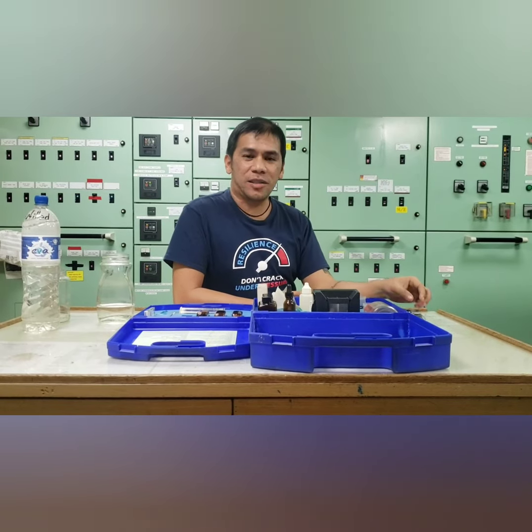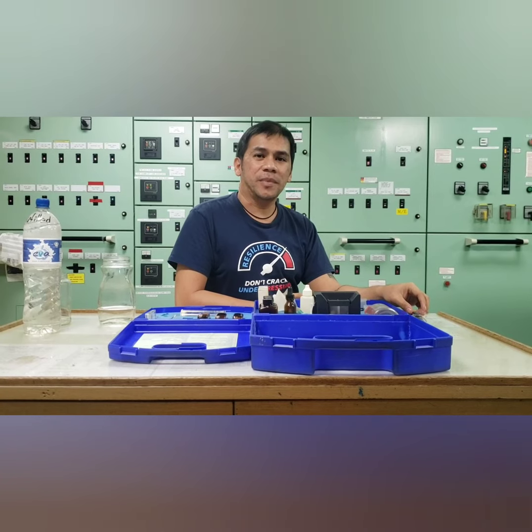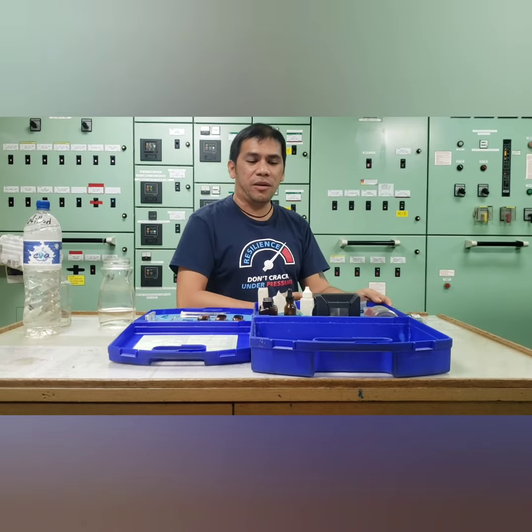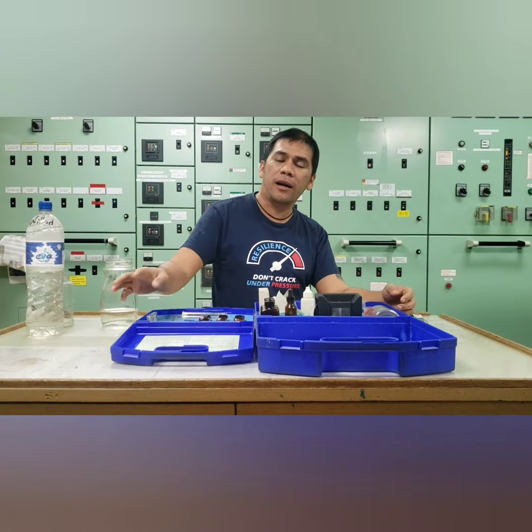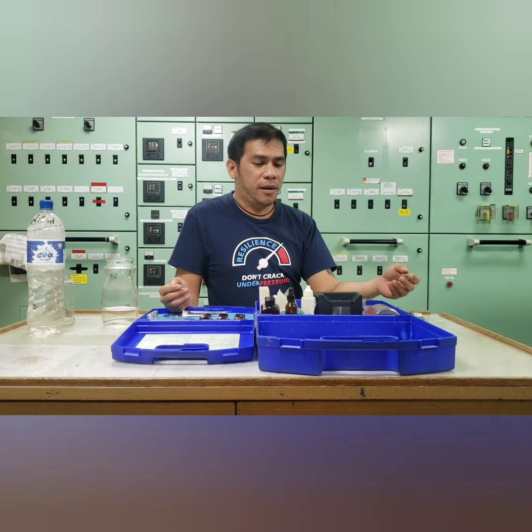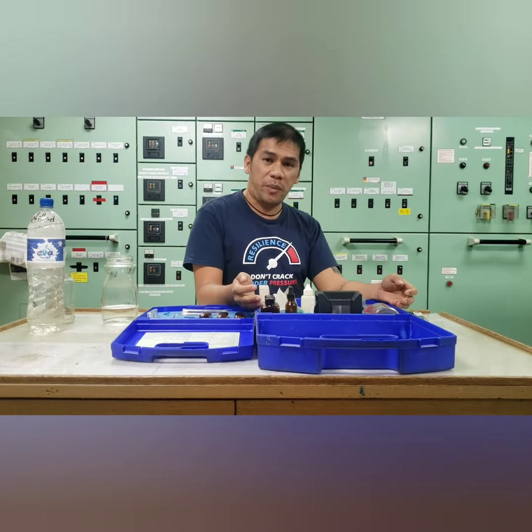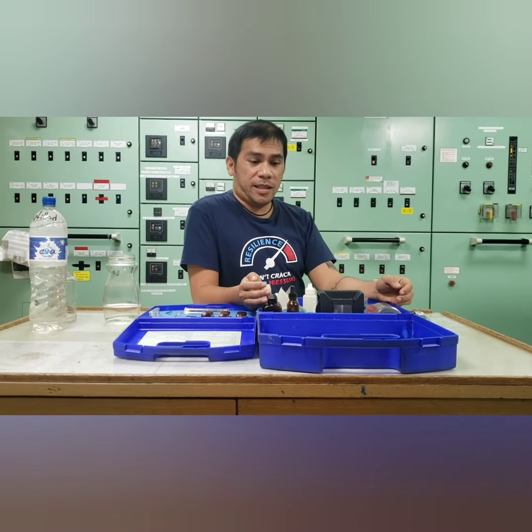Good day, everyone. So we have discussed last week about the cooling water system. So for today, I have to show you the equipment used for our water analysis for jacket cooling water and for the boiler water. First, I will show you the equipment of our boiler water for testing.